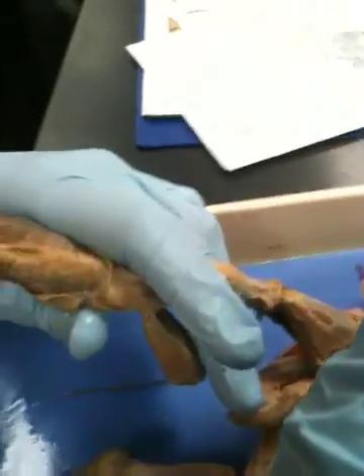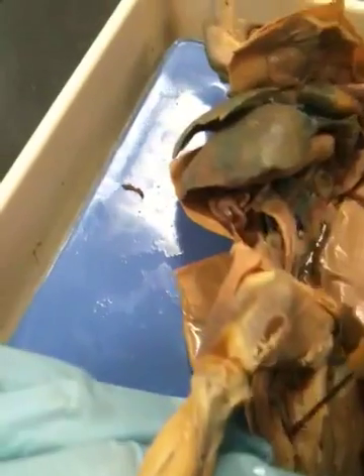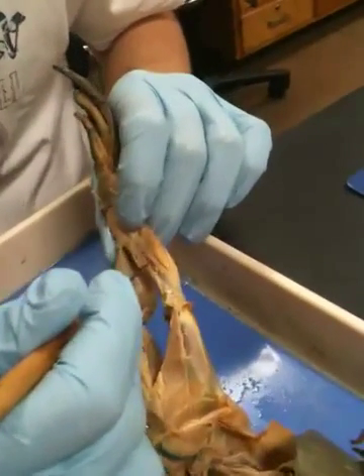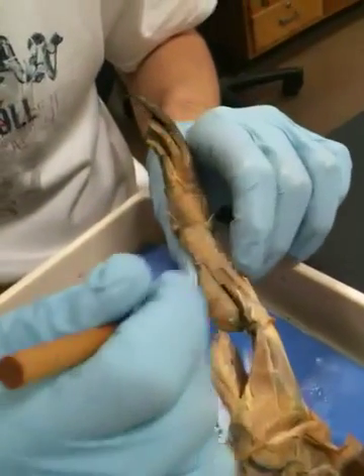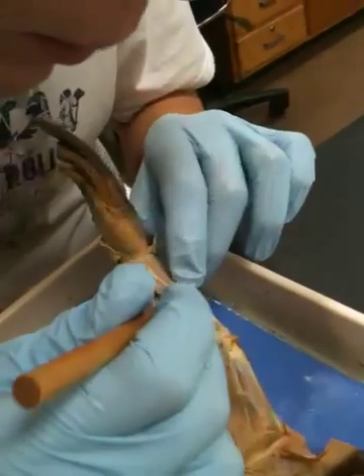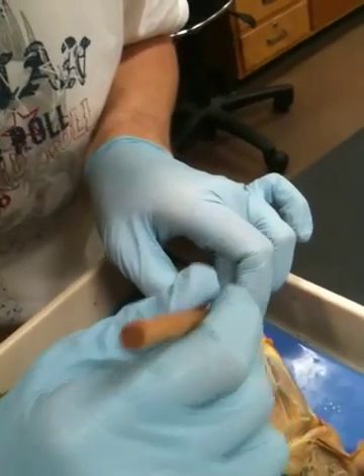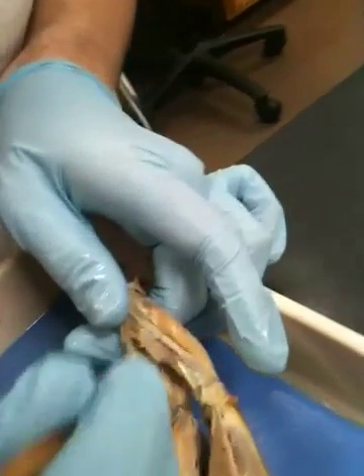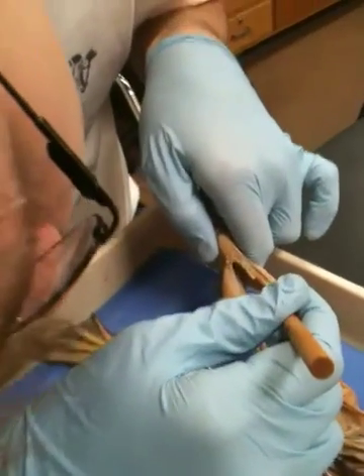Then also the sciatic artery. The sciatic artery runs in between the gracilis major and the semimembranosus, which is going to be somewhere deep inside of this tissue. From there, we also have the peroneal artery and the peroneal vein, which runs through the peroneus, this muscle. And then the tibial vein runs next to the tibia, if I can find it, right here.